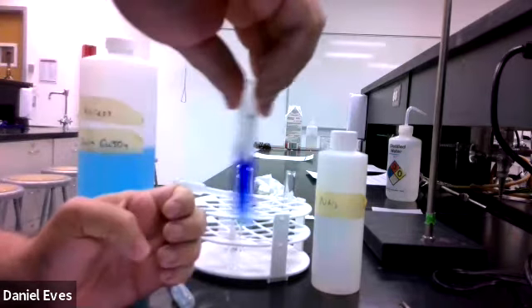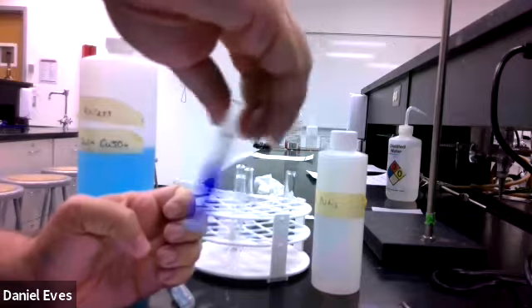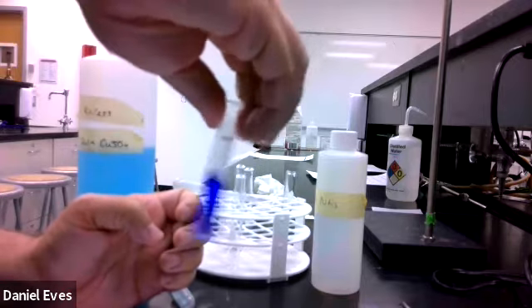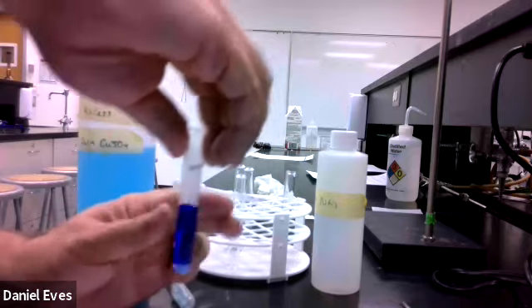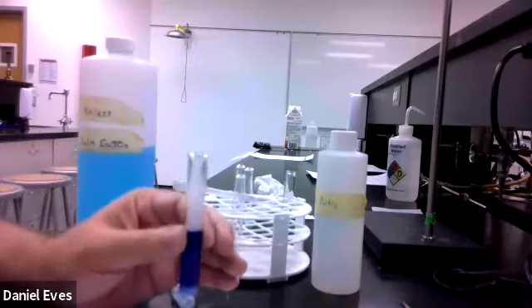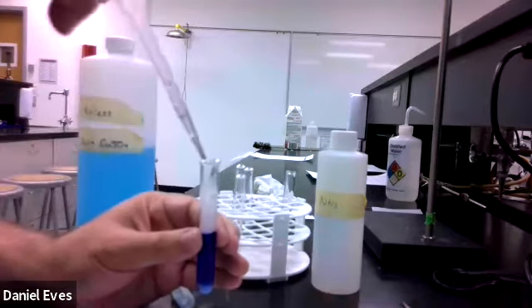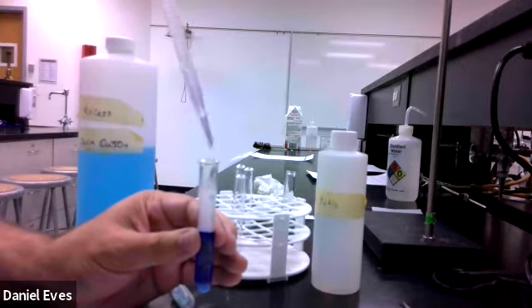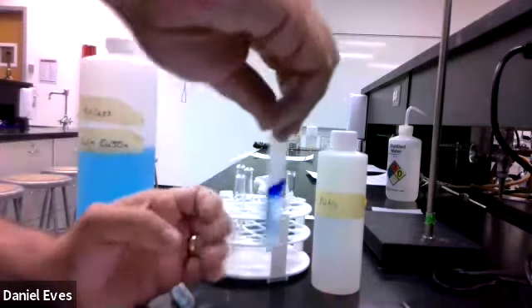And you should start seeing that dark blue and the precipitate start to go away. So a little bit more acid. You should be able to see the precipitate layer just a little bit better. We're going to add some more acid here, see if we can make it go back to its initial coloration.